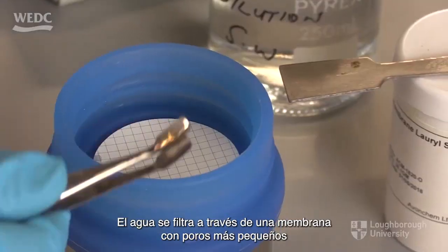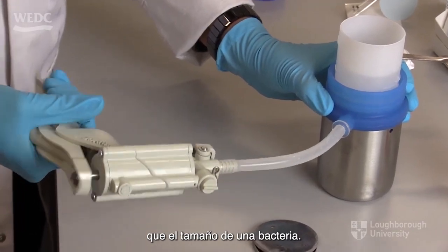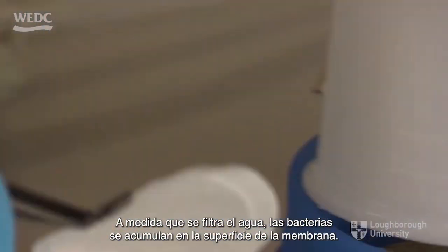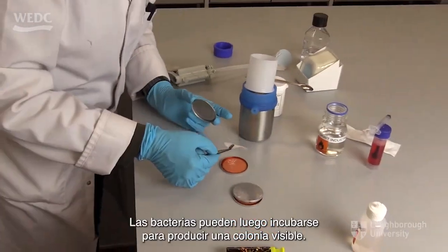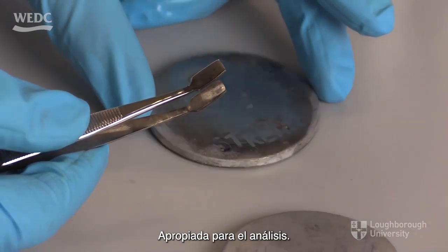Water is filtered through a membrane having pore sizes smaller than the size of a bacterium. As water is filtered, bacteria are collected on the surface of the membrane. The bacteria can then be incubated to produce visible colonies suitable for analysis.